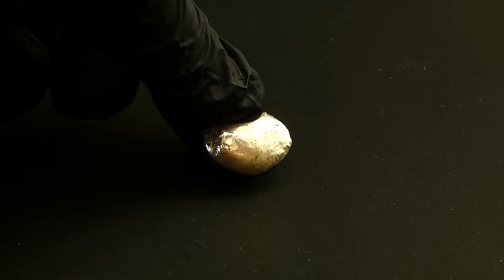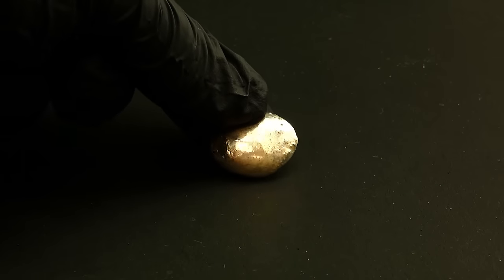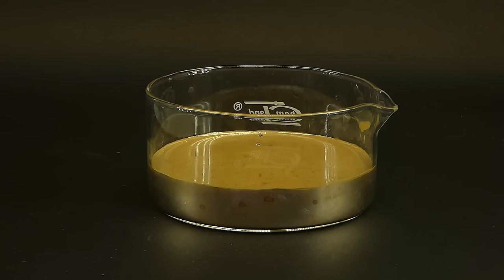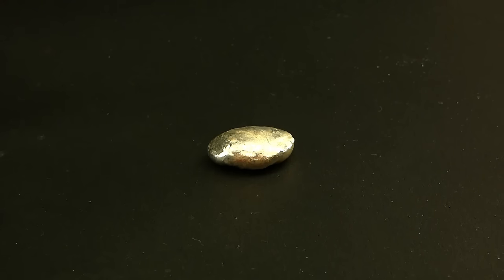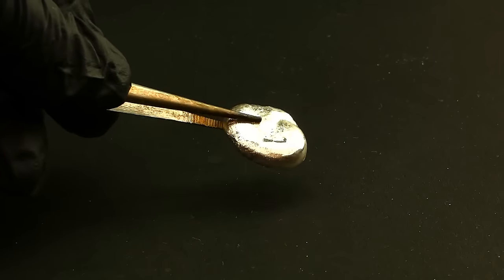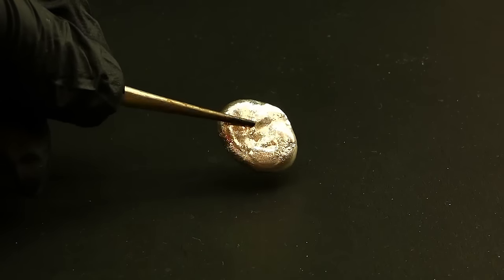In theory, all that I'm going to need is just some silver, and using a lot of chemistry magic, I can deposit it on a glass surface making a mirror, which when put that way doesn't seem too bad at all. I also specifically need to use silver here because it is literally the perfect thing for making mirrors, due to being a very unreactive and reflective metal.